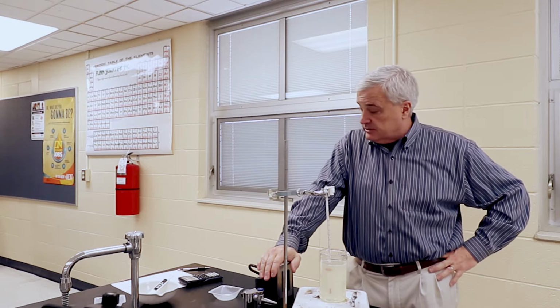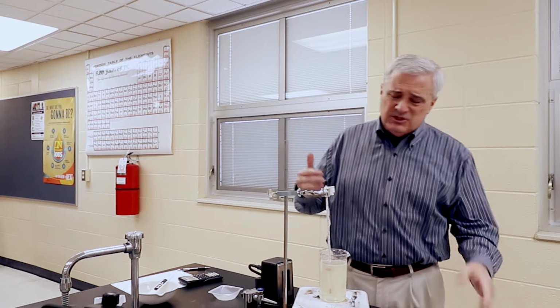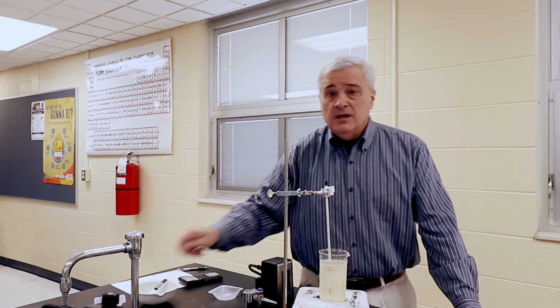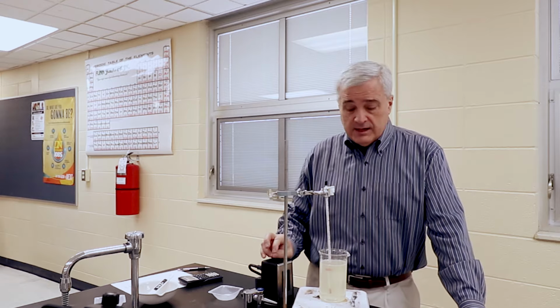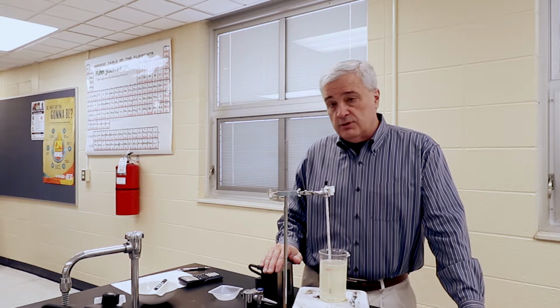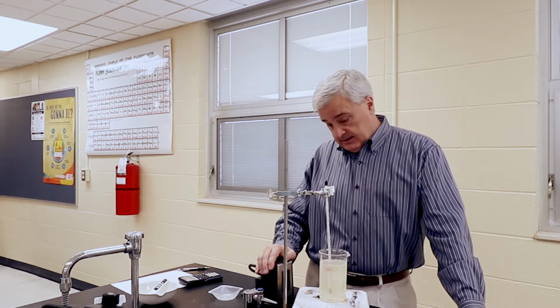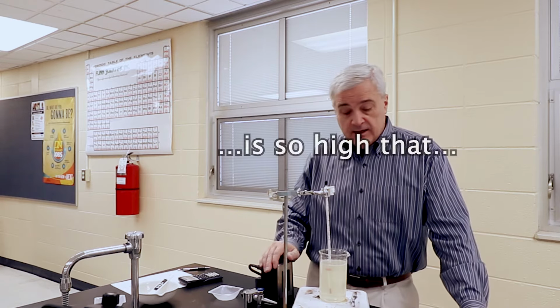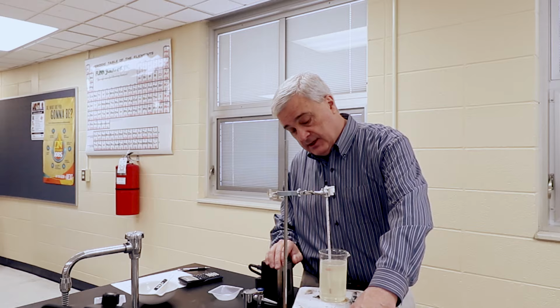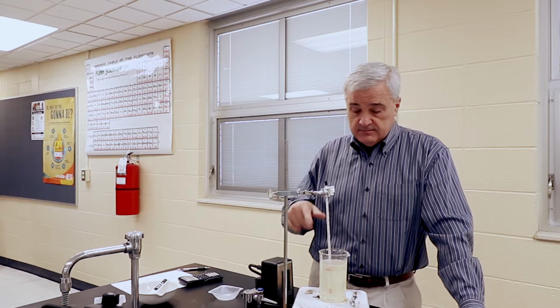We have put a lot of sugar in here, and I've had to stir with the spatula a couple times, which is probably taking a few drops of the solution out, which is throwing our numbers off. If we're making medicine, this would probably violate a lot of procedures and protocols. But apparently we're making candy because this is so thick now. Even with the temperature increasing, the viscosity is such that the little stirring magnet is having a lot of trouble continuing to spin, so I had to turn down the speed of the impeller.